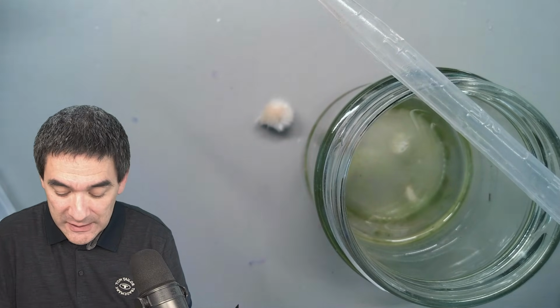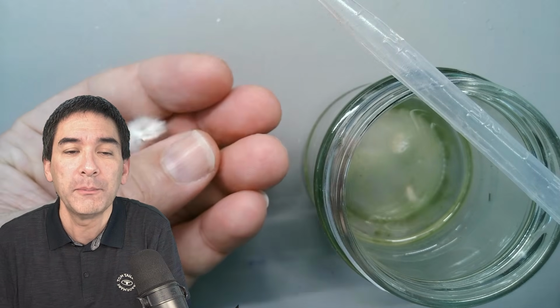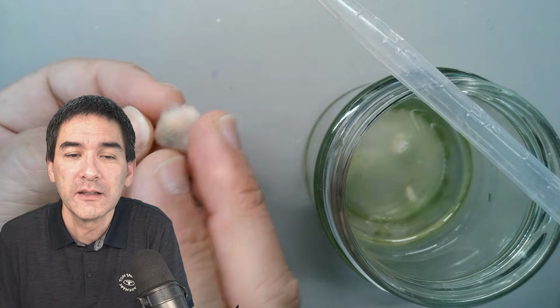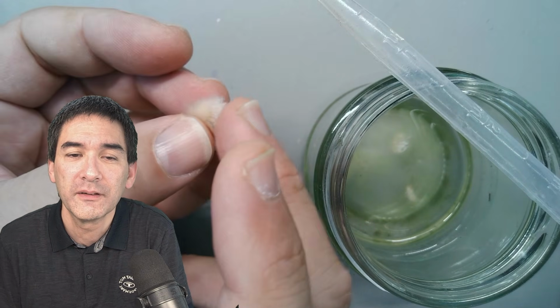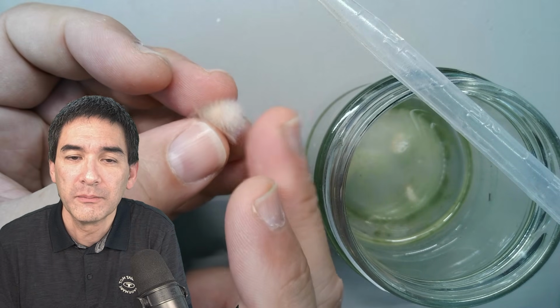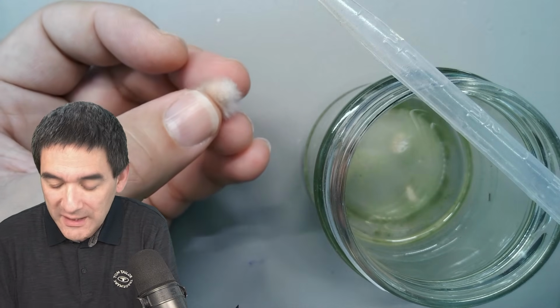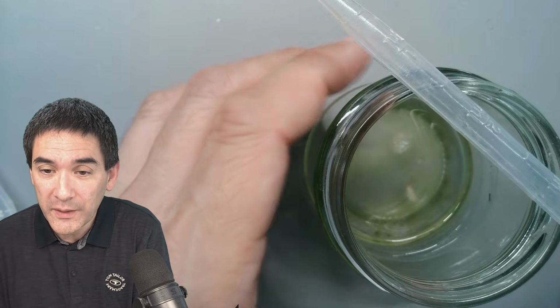And then last but not least, look at this here. This is called a catkin, which I kept from springtime. I would also like to put this under the microscope, specifically I'm going to cut off some of this fuzz over here, and this is also quite nice to look at. It shows us a little bit how fine the structures and the details are. Okay, so that's basically what I would like to do today.